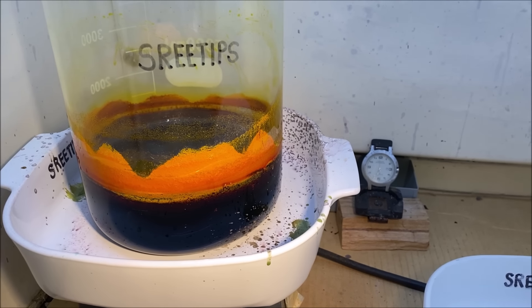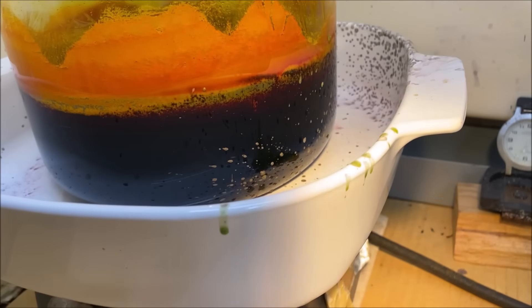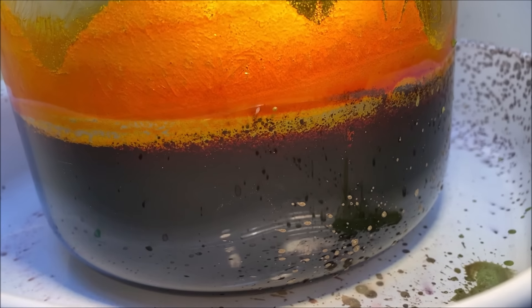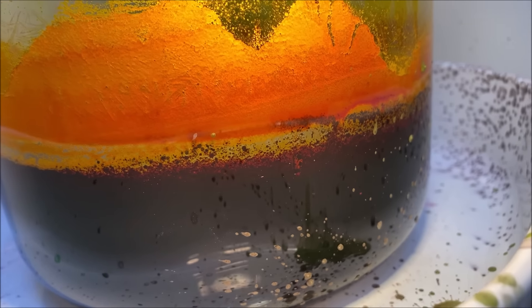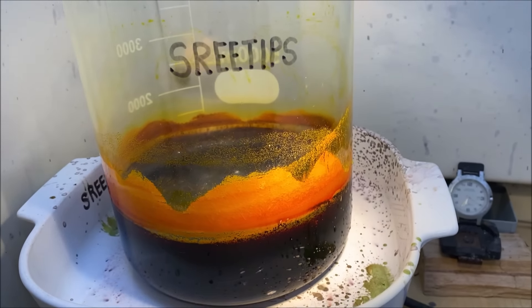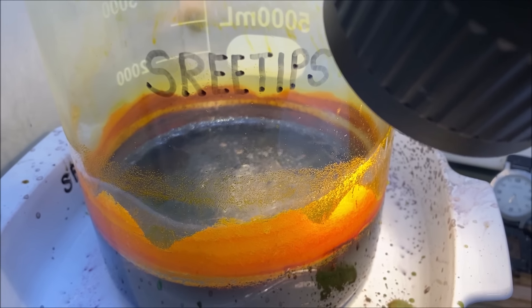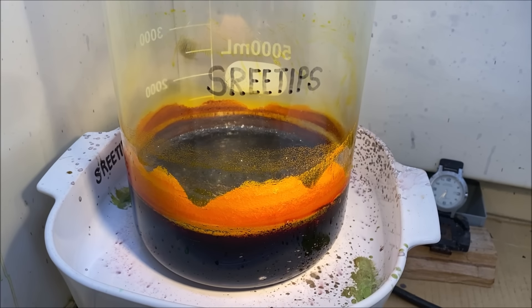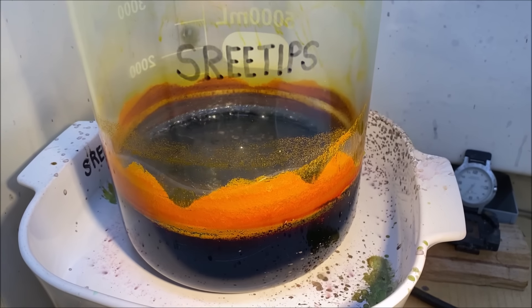It's about 6:30 on Friday morning and I've been working on this since Monday. You can see the chloroauric acid is beginning to crystallize in there, but it's taken five days to get to this point. There's so much gold in there it's not evaporating as quickly as I'd like — you can see it's still liquid in there.